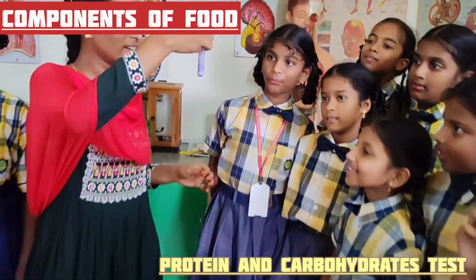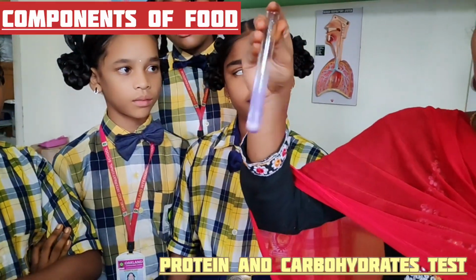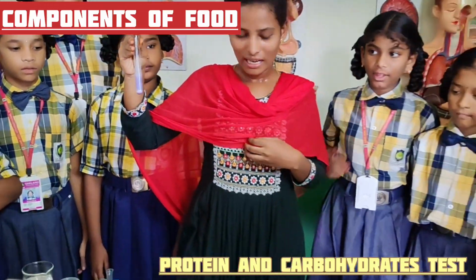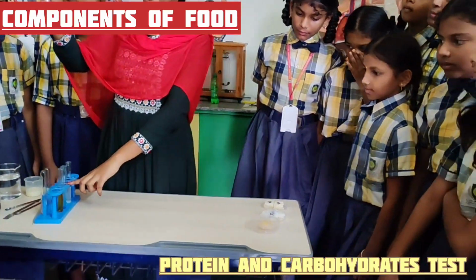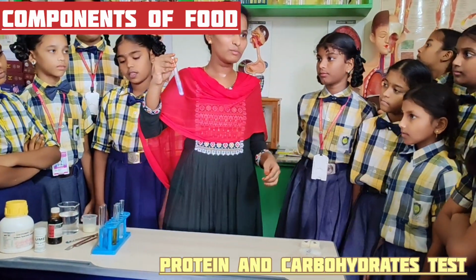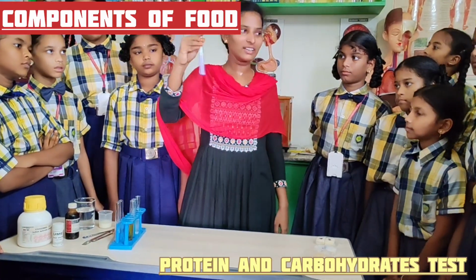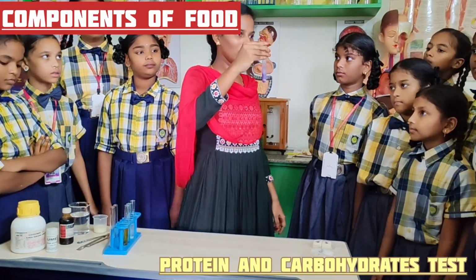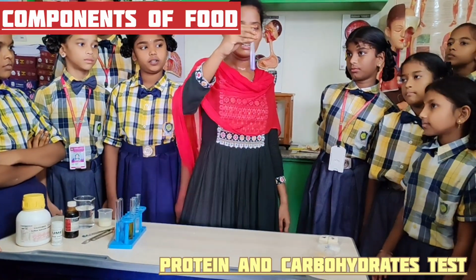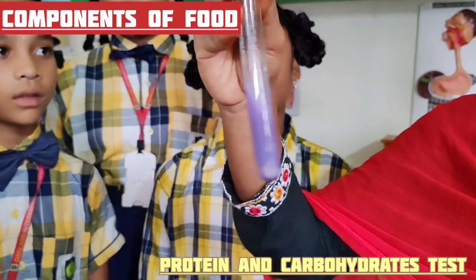Which color is appearing? That means pale violet or purple. Already I said to you, for any food material, when we add a few drops of copper sulfate and 10 drops of sodium hydroxide solution, if it gives purple or pale violet color, it indicates the food material is rich in protein.